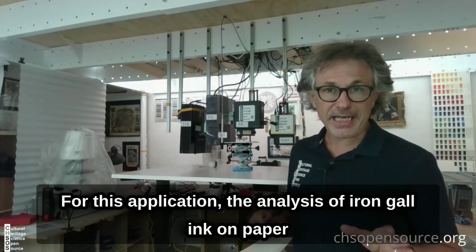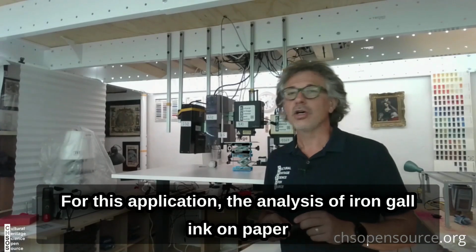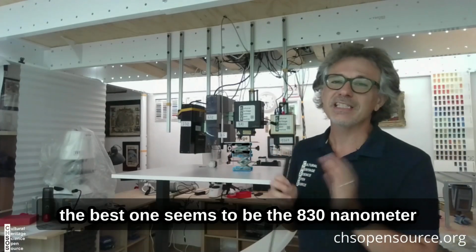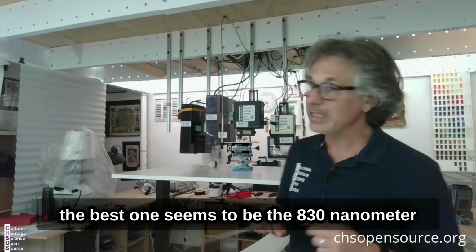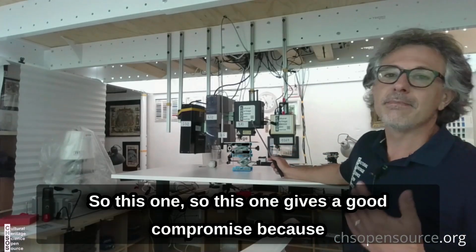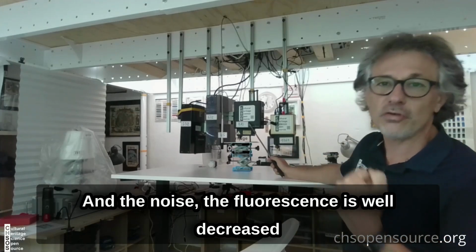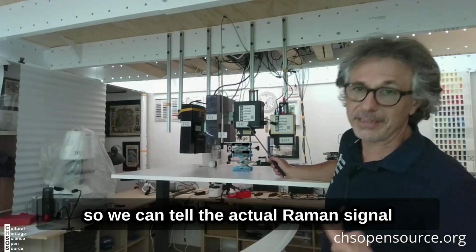For this application, the analysis of iron Gall ink on paper and on parchment, at least for the system that I have, the best one seems to be the 830 nanometer. This one gives a good compromise because we still have a good Raman signal that we can detect, and the fluorescence is well decreased, so we can tell the actual Raman signal.